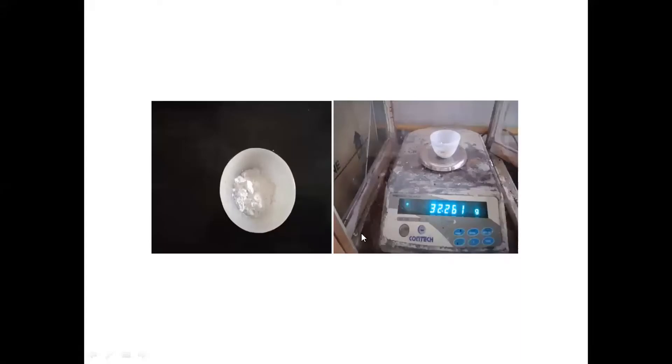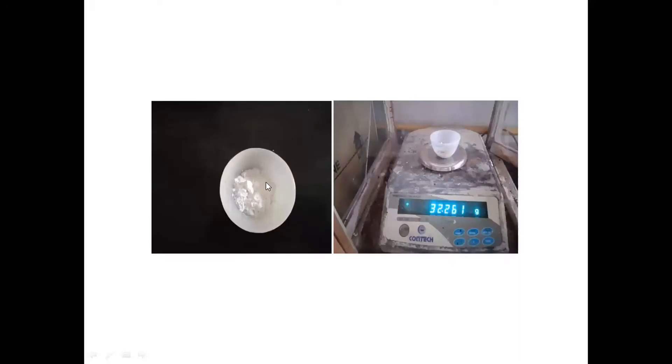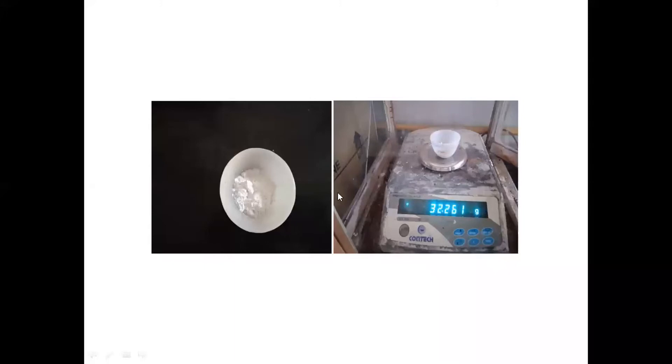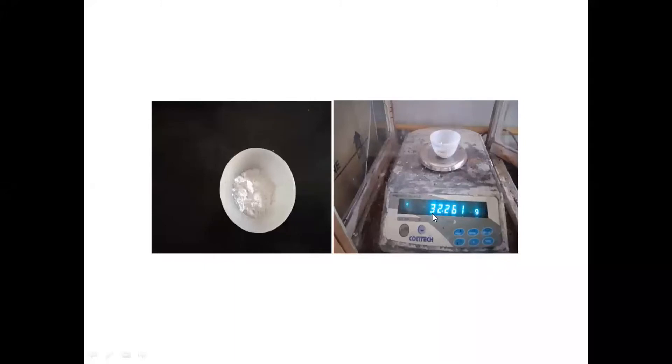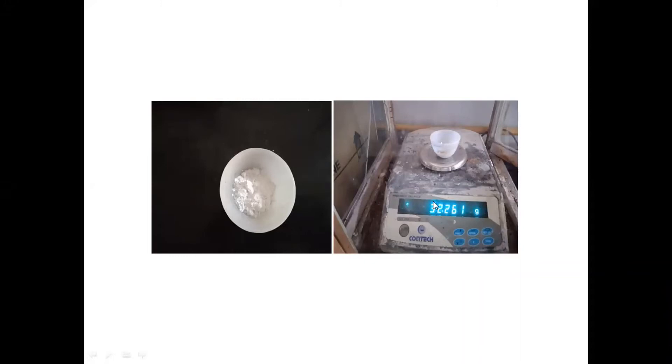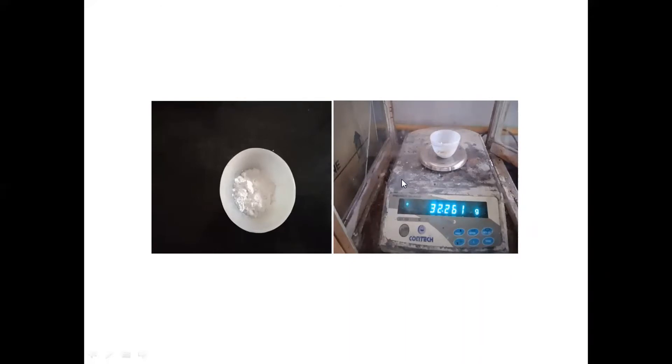After one hour, we have removed the soap sample from the hot air oven and measured the weight of the sample. The total soap sample is dried and the total weight of soap sample including crucible is recorded as 32.261 grams. Now we will move towards the calculation of moisture content.